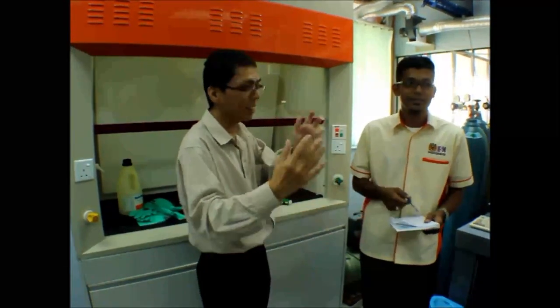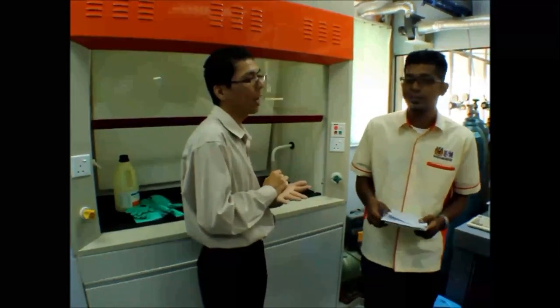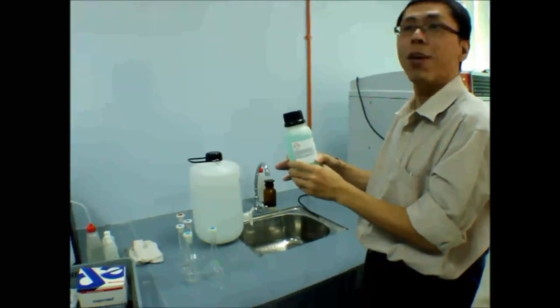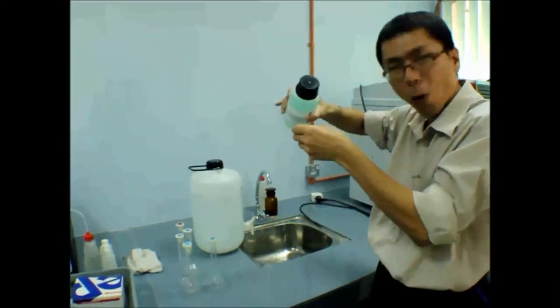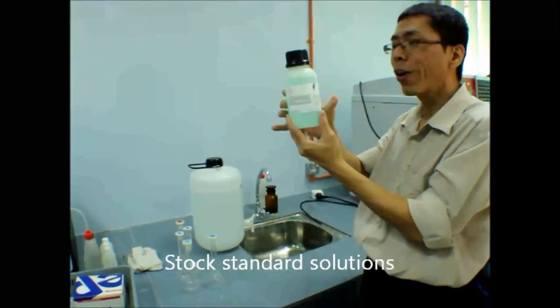Okay, then take out and prepare. So a lot of things you need to do. You confirm your apparatus is very clean and you can take. If not, better don't. You pour out the liquid and transfer, to avoid any contamination.